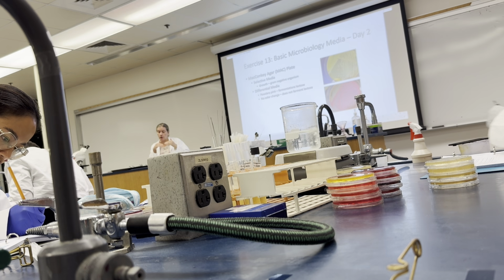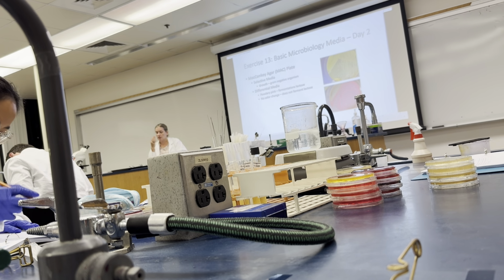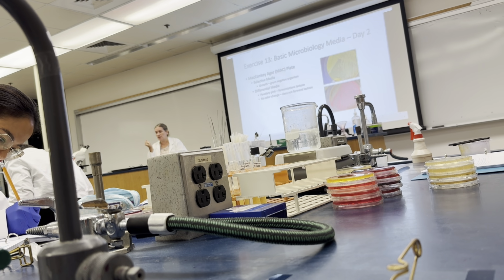What category do they fall under, right? Selective, differential, general, that type of thing, enrichment. What does it mean to be selective? What does it mean to be differential? What does it mean to be a general purpose or an enrichment media?